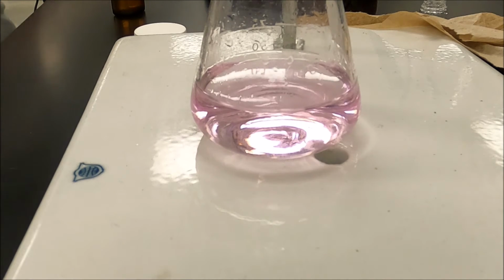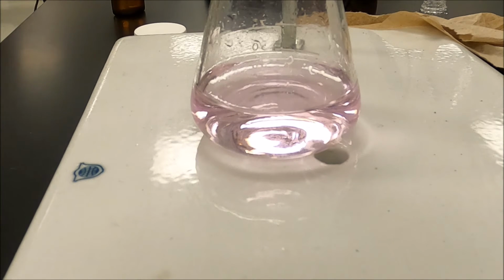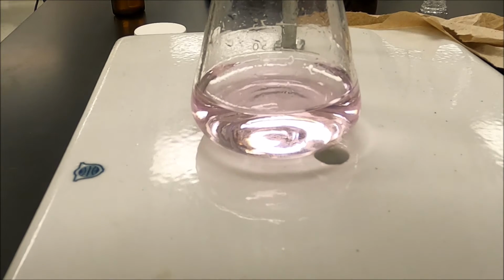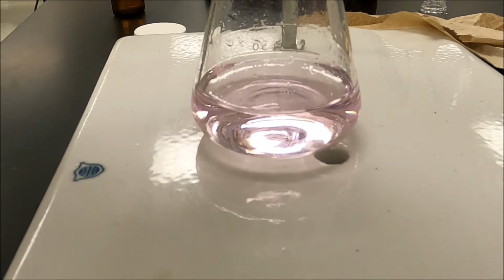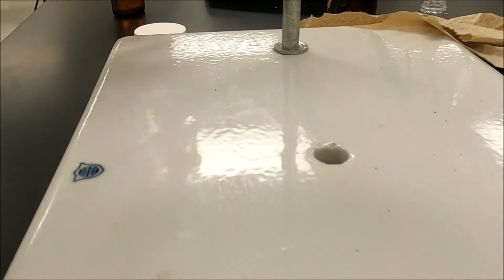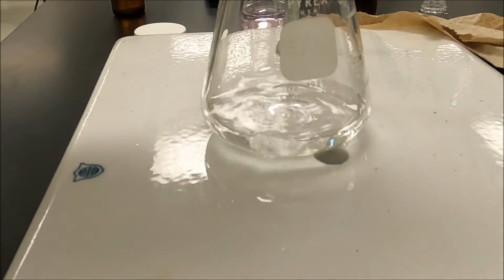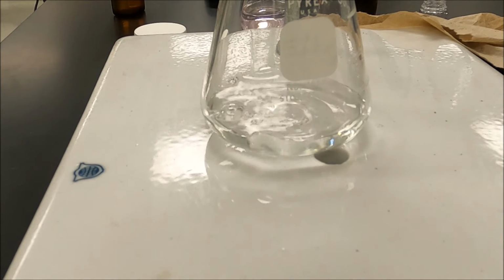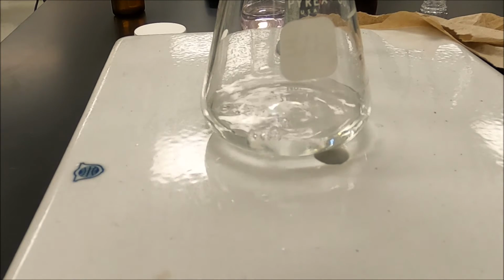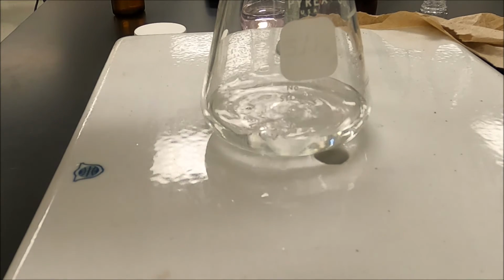Now our initial burette reading here for run 1 was 0.00. Our final burette reading is 21.90. Okay? So we can do the second one without having to redo. Your initial burette reading for the second one is 21.90, so I'm going to go around 42 and slow down.